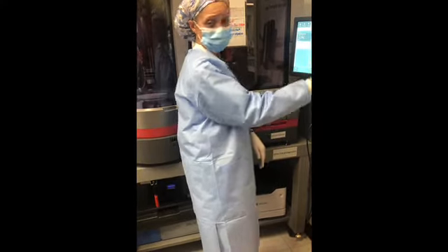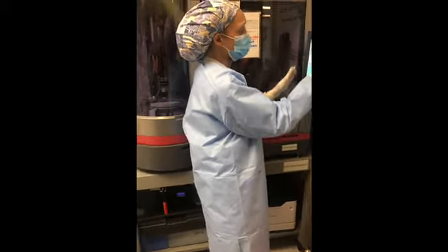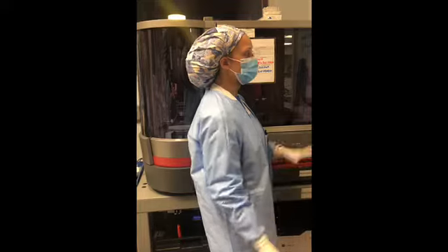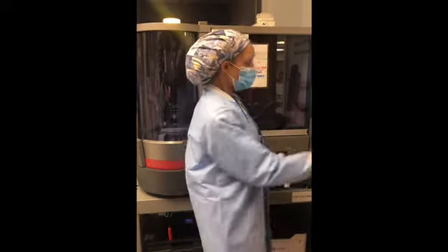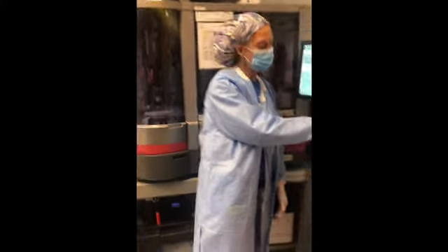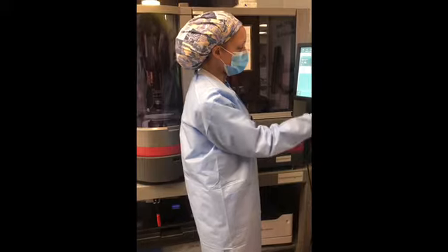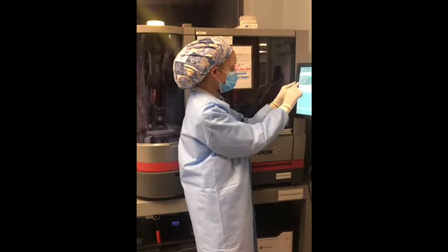You'll click OK. You'll click Next. Then you'll put in the little box, OK. Click Next again, and then you'll put your password to accept it. Once you do that, you have to hit Accept down here at the bottom. After it's accepted, you will see the check mark for the accepted.